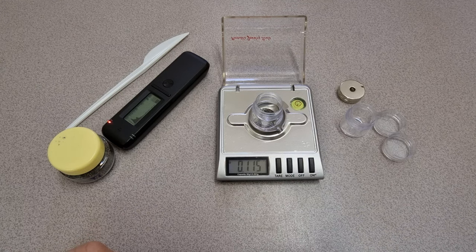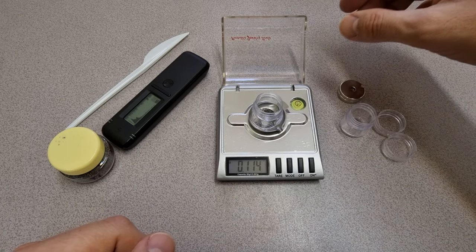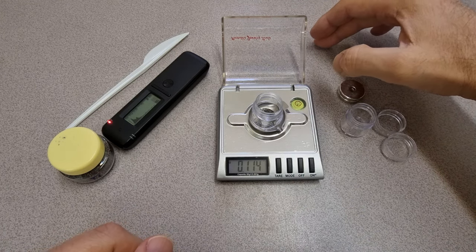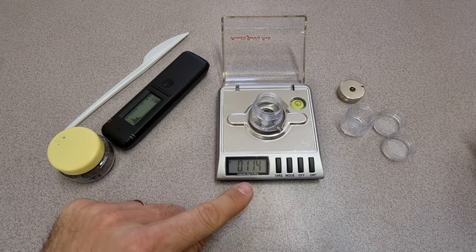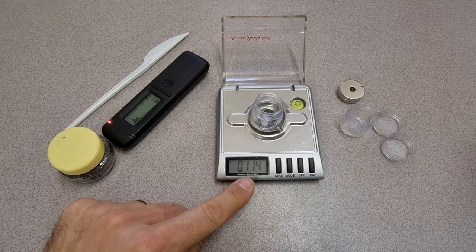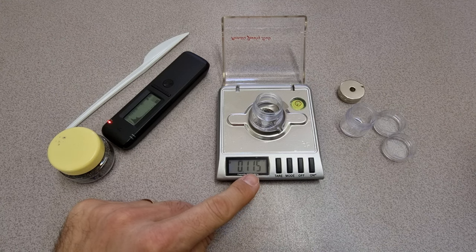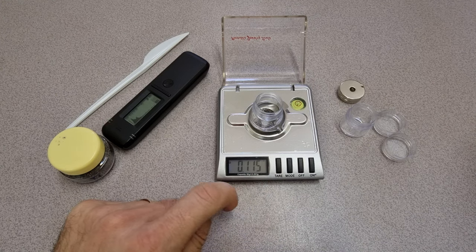Now we're going to see if we can magnetically separate these. I've not done this, so this could be a disaster. So for purposes of record, this is 0.115 of a gram.